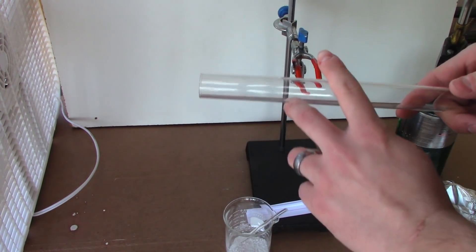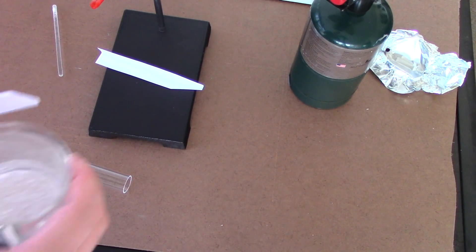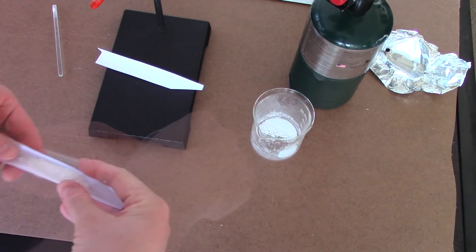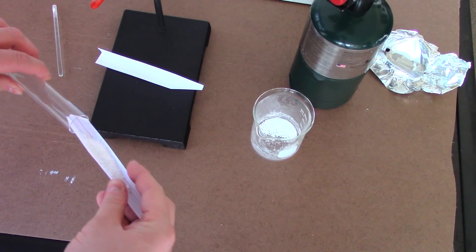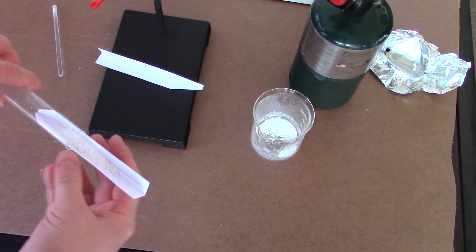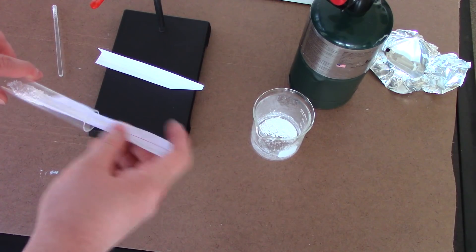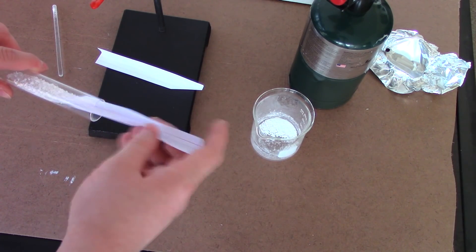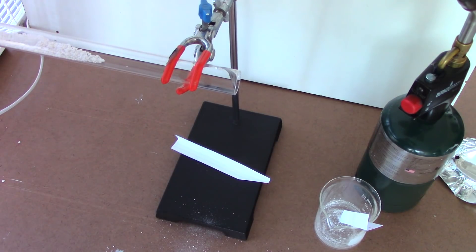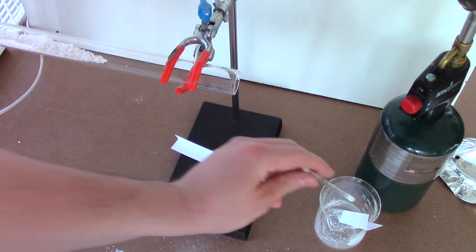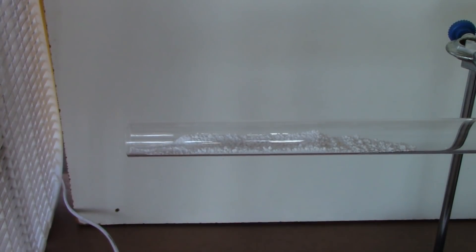So, let's go ahead, load it in here, and get the torch on her. I've got these little, sort of, redneck-made scoopulas. I'm not sure if I'm being a little overzealous trying to do the whole batch at once. We'll see how this goes. It actually went way better than I expected. Now, I have a white backdrop here, so hopefully you guys will be able to actually see some of the nitrogen dioxide given off. This whole reaction has just been making nitrogen dioxide at every step. Very fun. Very exciting. Alright, got a fan set up on low. I am going to start hitting this with the torch.